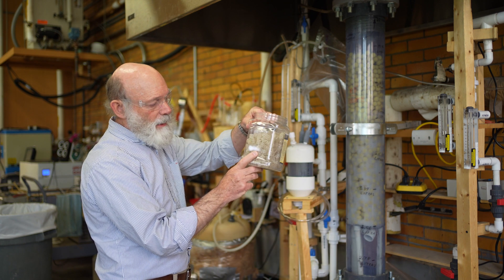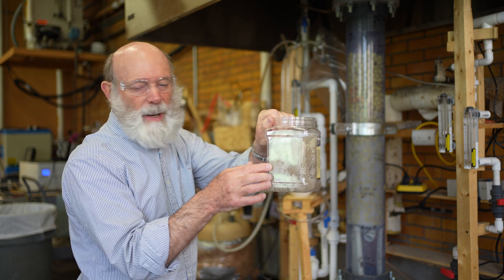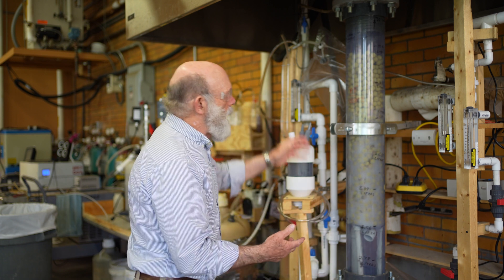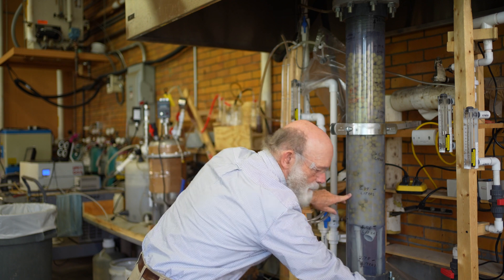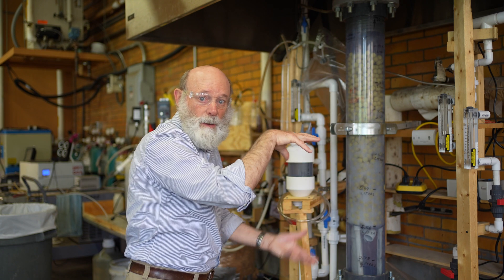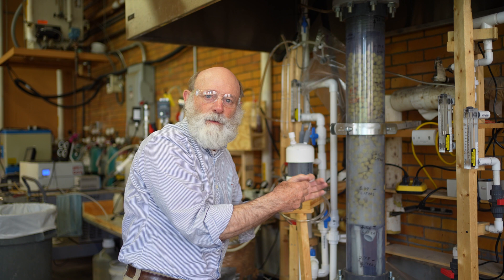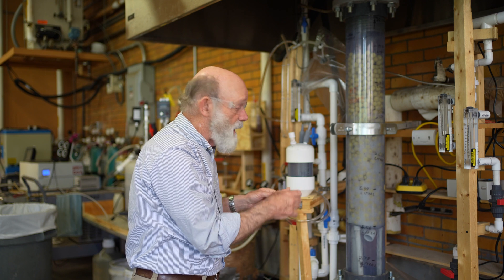In a previous run we used a different type of packing. These are standard pall rings that could be used in industry — made out of polyethylene. The idea of having packing in a column is to allow the gas, which is coming up through the column, and the liquid, which is being pumped by this pump here and spraying down into the packing, to contact each other so we can get mass transfer and convert the hydrogen and carbon monoxide to acetic acid.